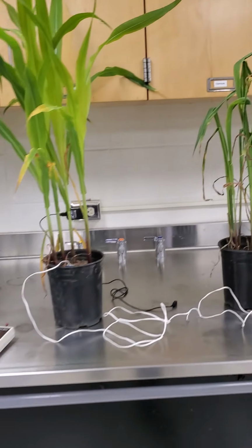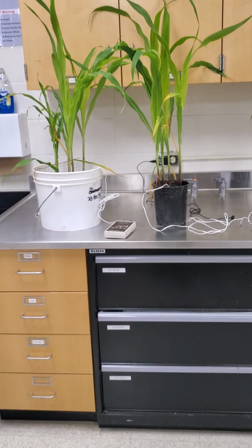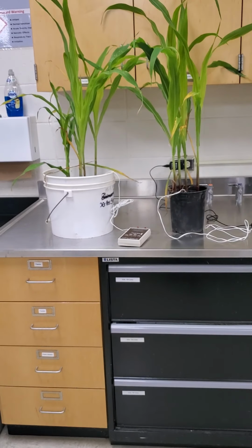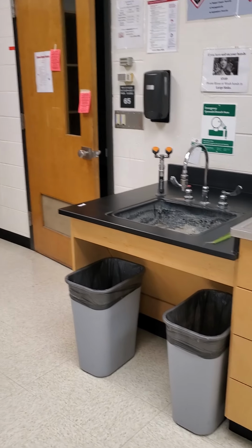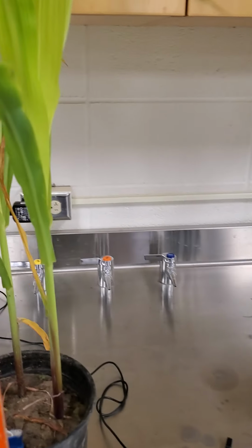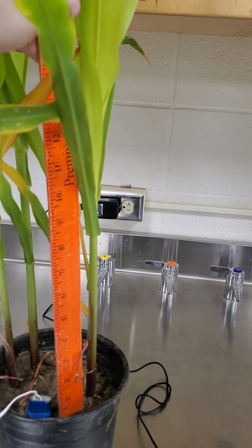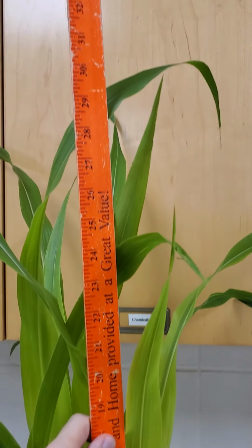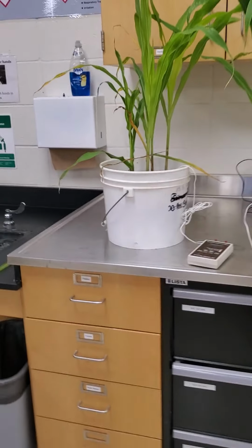The next set of data is going to be what is your plant condition? There are 3 different things that we're going to be looking at. First is just plant height. So just looking at how high the plants are out of the pot. I've got a ruler here. Just put it down in the pot and look generally how high the highest leaves are in each. That's simple, pretty easy to understand.